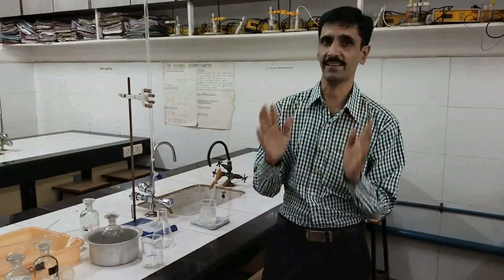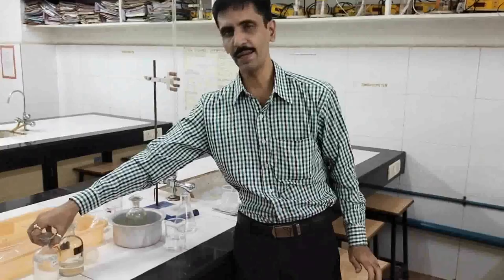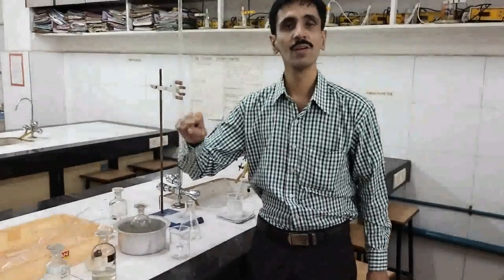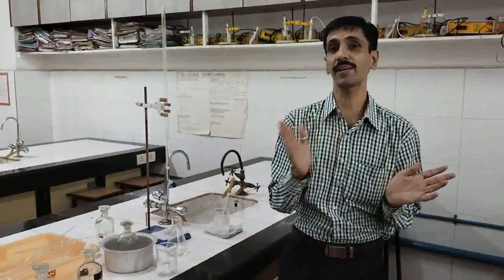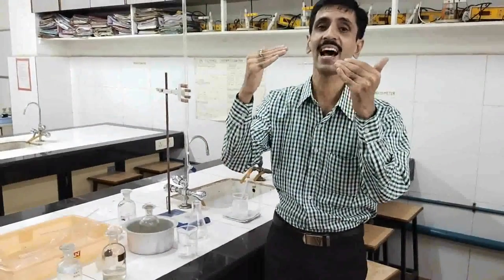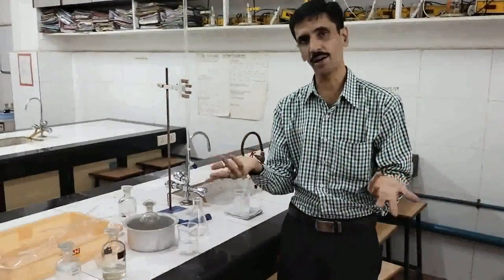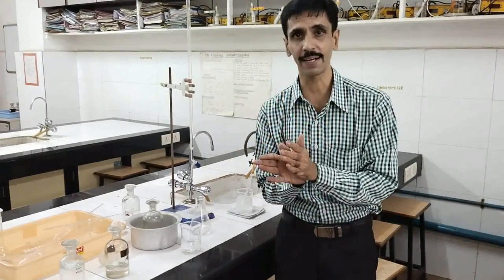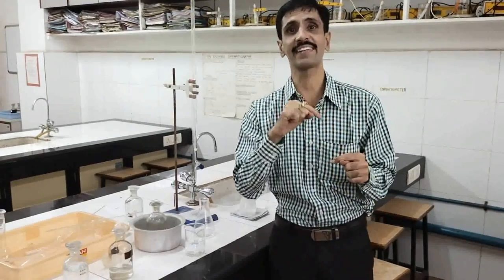The difference in Set 2 is that we take 25 ml of K2S2O8 and 25 ml of KI, with 25 ml of distilled water added to each. This makes the initial concentration half of Set 1. Therefore, for a given time interval, the titration reading in Set 2 will be less than the corresponding reading in Set 1.